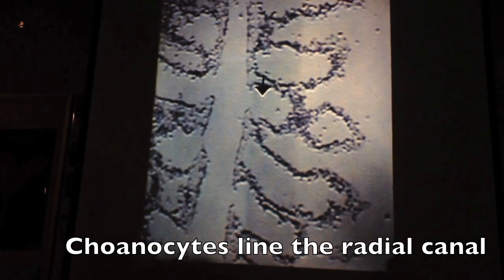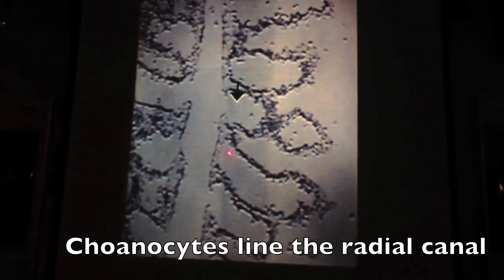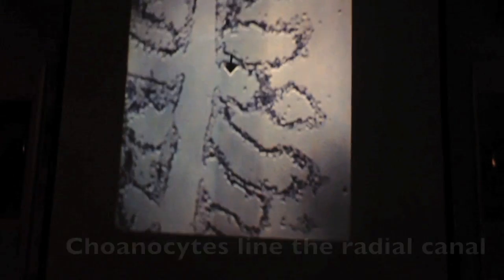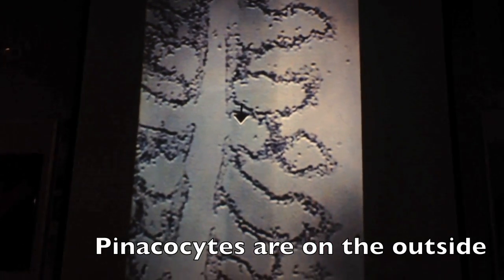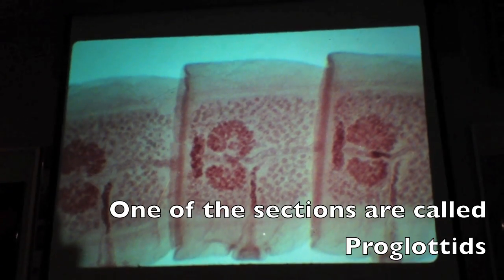Where would you find the choanocytes? Choanocytes line the radial canals. And pinacocytes are on the outside. So what is one of these sections called?